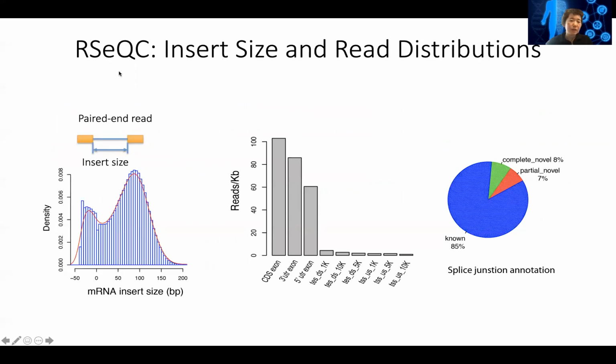For RSeQC, there are some RNA-specific QC measures, such as the insert size. If you are dealing with paired-end reads, you might want to look at what your insert size is. Most of the time when people are isolating the RNA to put it on the sequencing machine, they sequence like 200 base pair reads. So you can see this is probably from the early days, 50 base pair on each side. The insert size is about 100. So you know that, okay, this is a pretty good one.